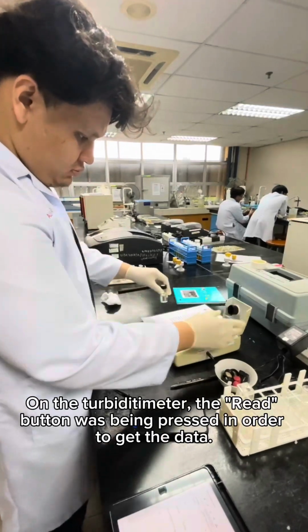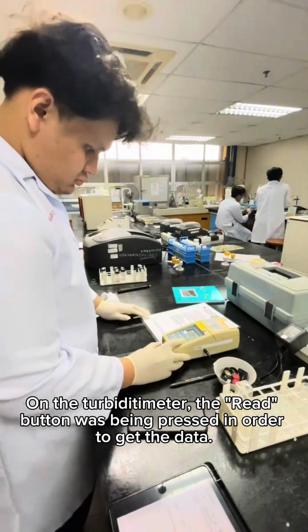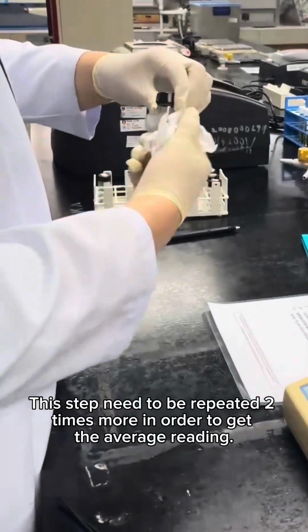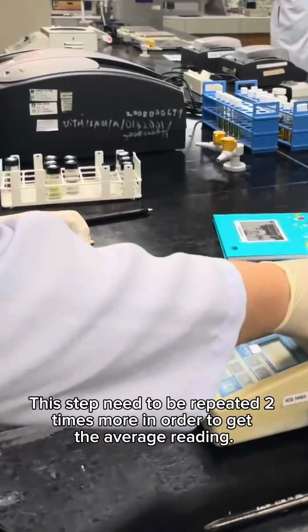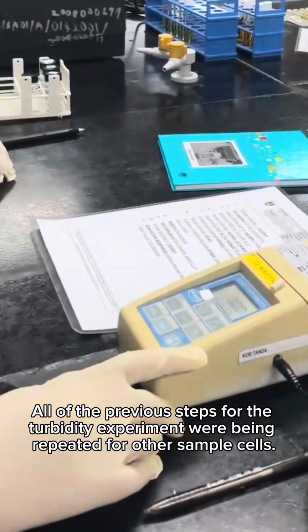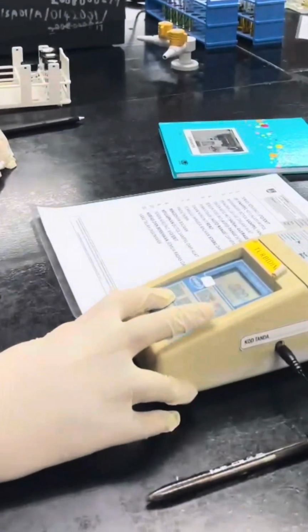On the turbidimeter, the read button was pressed in order to get the data, and then the data is recorded. This step needs to be repeated two more times in order to get the average reading. All of the previous steps for the turbidity experiment were repeated for the other sample cells.